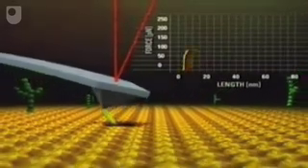Examining such a small tip is a challenge in itself. Another scanning probe technique, the scanning electron microscope, can help us to do this. The atomic force microscope tip has to be mounted in a suitable holder before we can insert it into the chamber of the microscope.